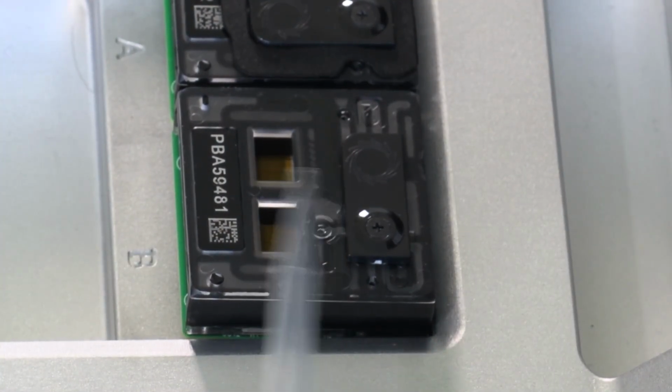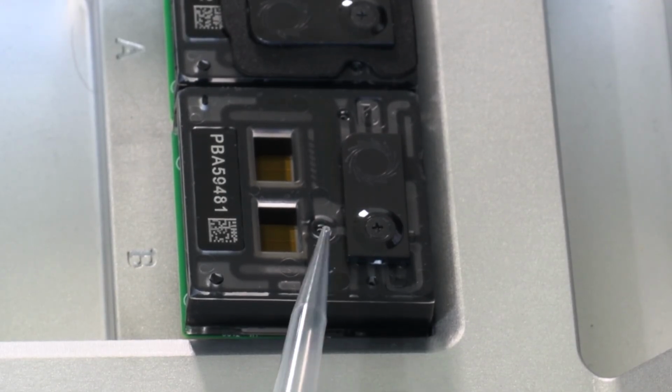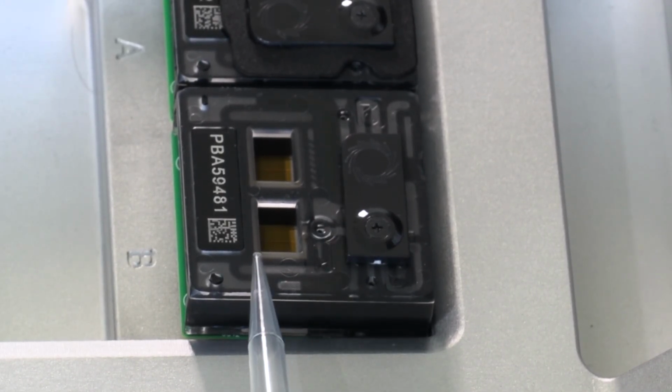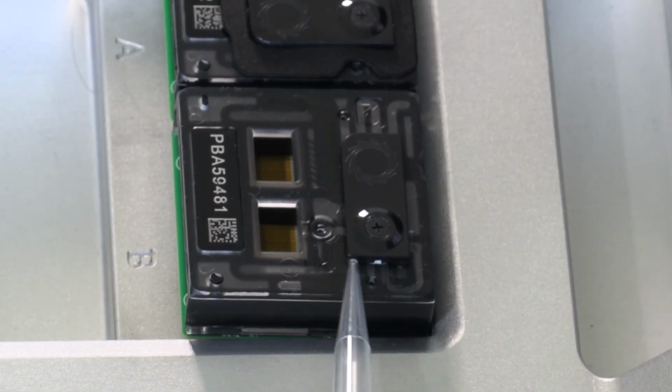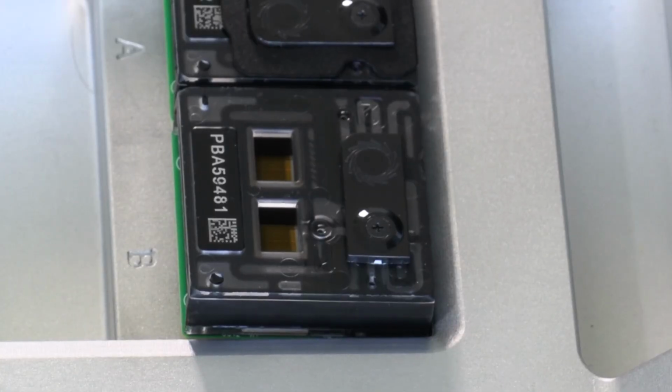The priming port that is exposed right now by opening the valve, as you can see, this part of the channel is colored in gray. The channels that are colored in gray have air in them. The channels that are of black color have liquid in them. To begin with, before we can do anything with the flow cell, we need to remove this small air bubble that's located in the priming port.